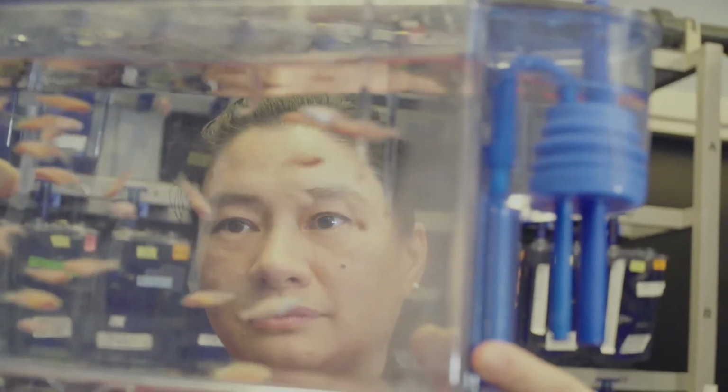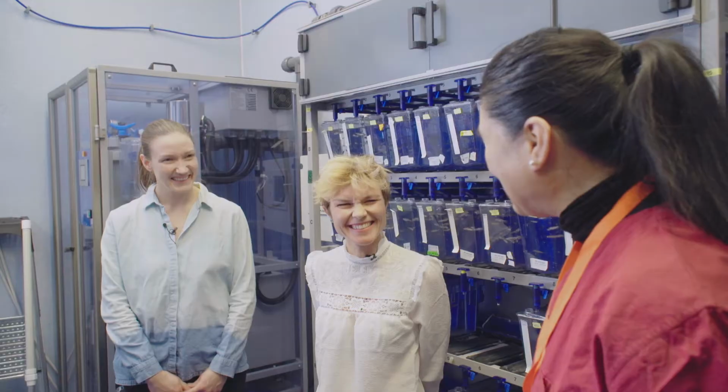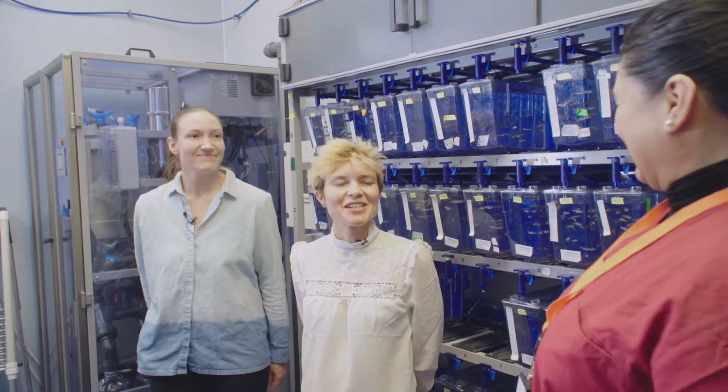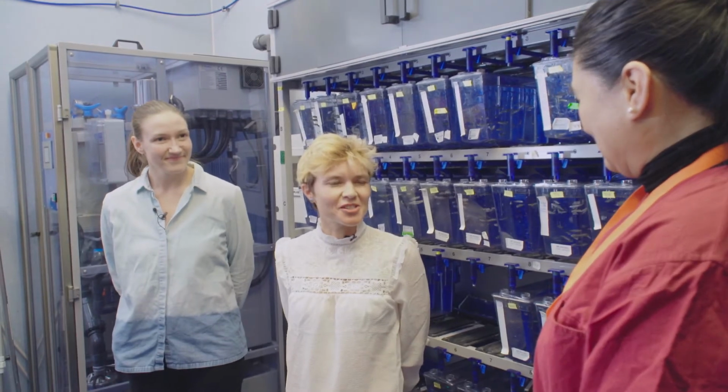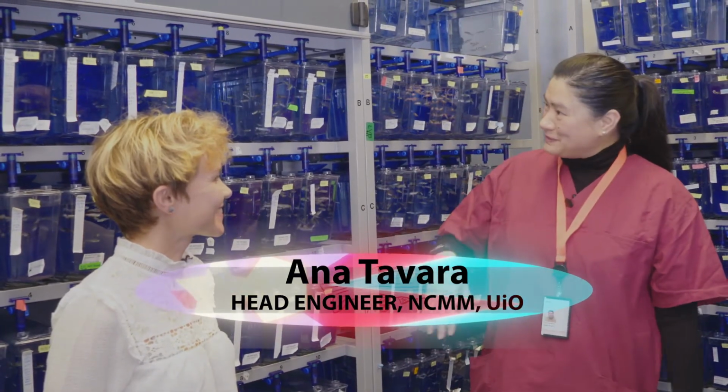Hi Anna, this is Ricci. Welcome girls. Hi Viola, hi Ricci, nice to meet you. So you're going to tell us about zebrafish today? Yes, of course. I'm going to answer all your questions about the fish.